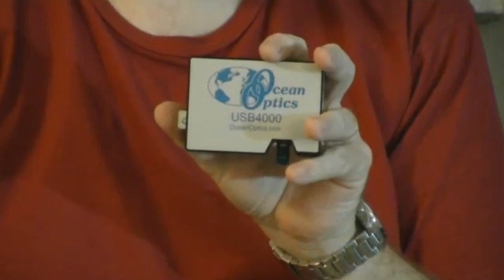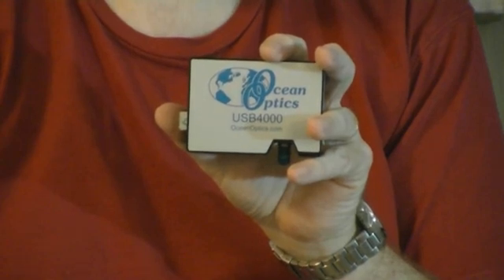Naturally, all research starts with analyzing the fluorescent emission of these fluorescent minerals. We needed a tool to do that. After browsing the market, our choice fell on the Ocean Optics USB 4000 fluorescence spectrometer, which we ultimately bought.